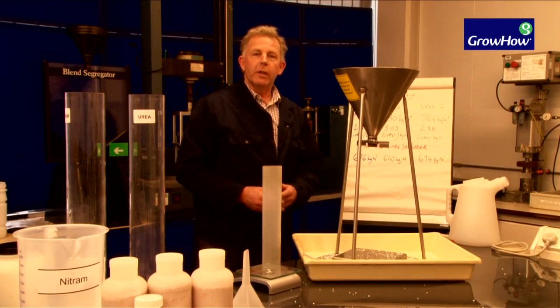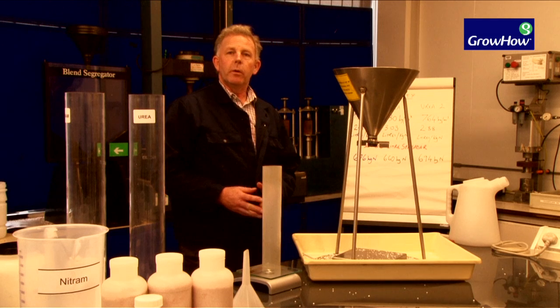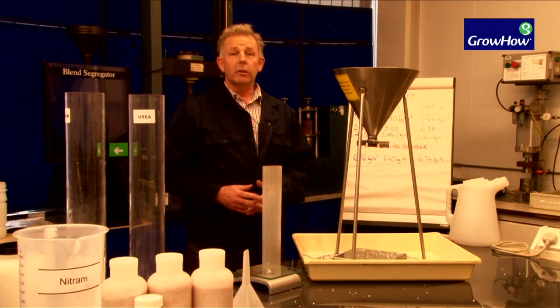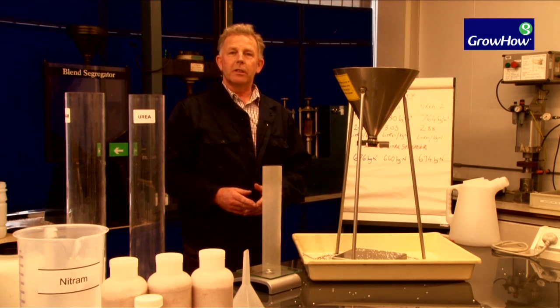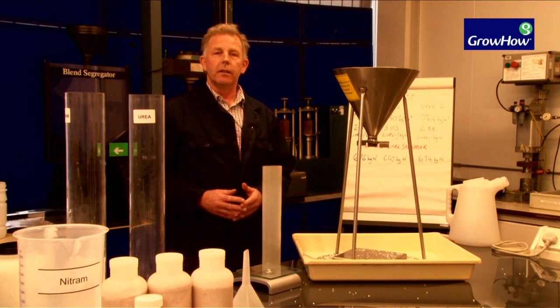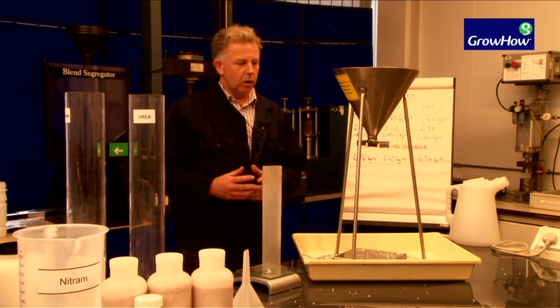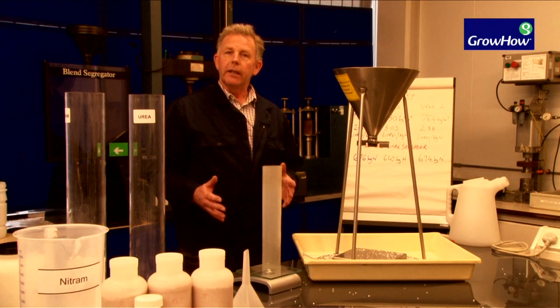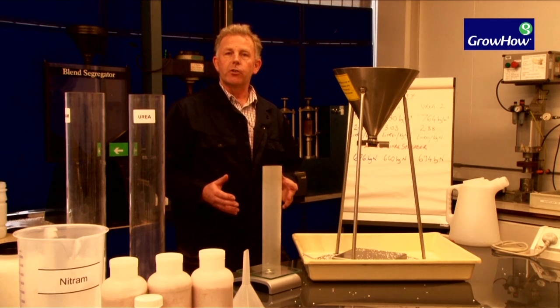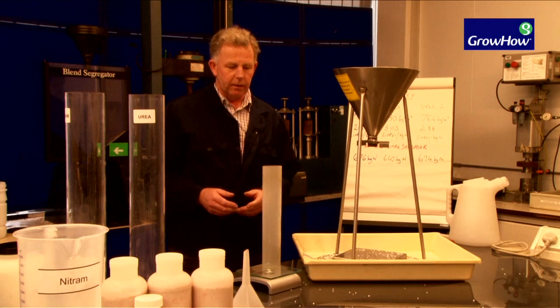As you've seen from the view we've had before, the bulk density of the product is critical to how much you can get in the fertilizer hopper. Here we have a little experiment to illustrate how we work out the bulk density.